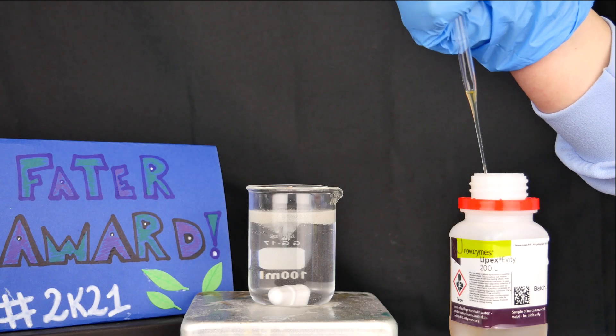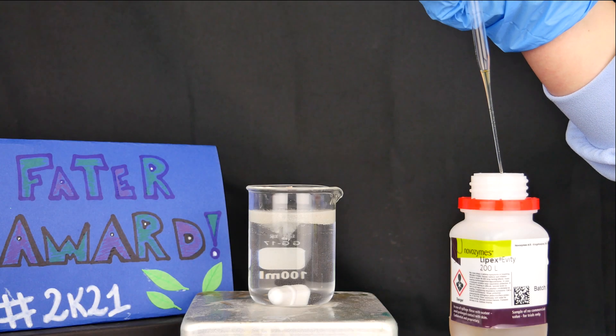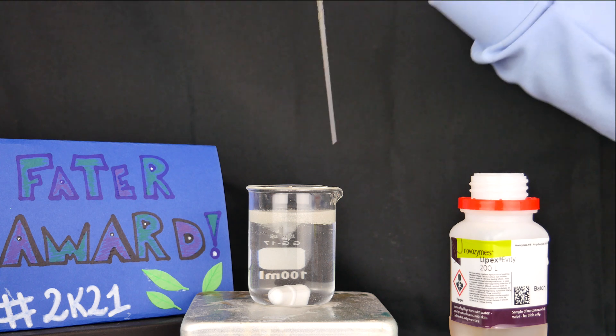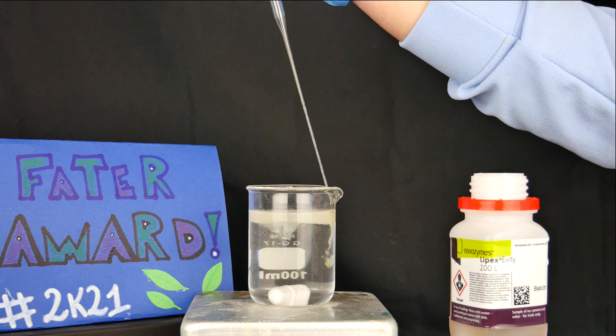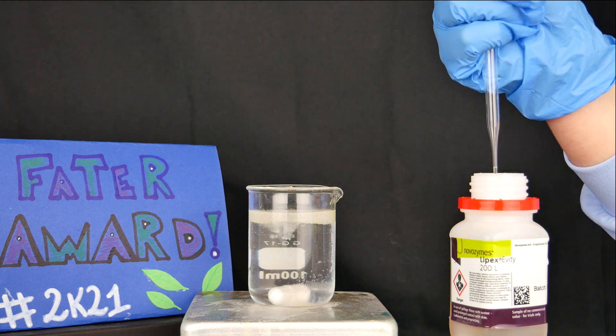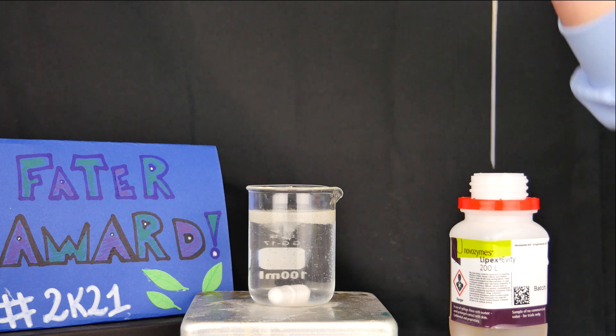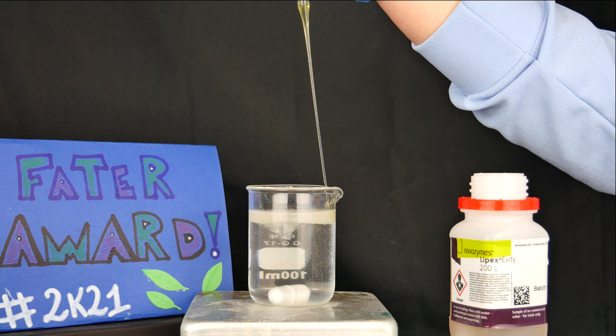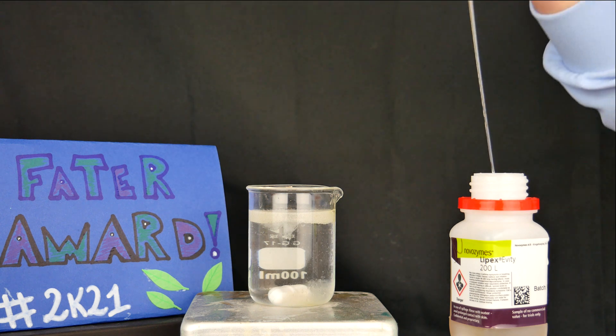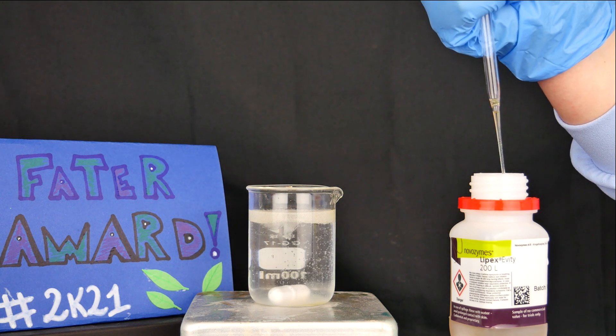In this video we will see the power of the lipase enzyme in the hydrolysis of triglycerides or oils and fats, which are the main sources of dirt in clothes. These enzymes are widely used in common washing machine detergents, and in this experiment we will simulate the washing conditions.